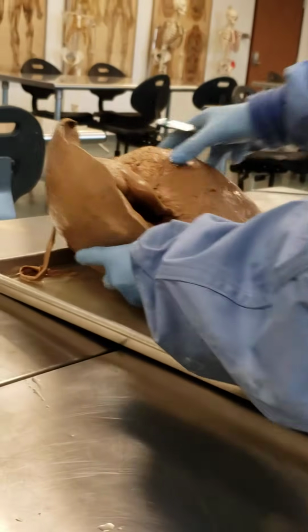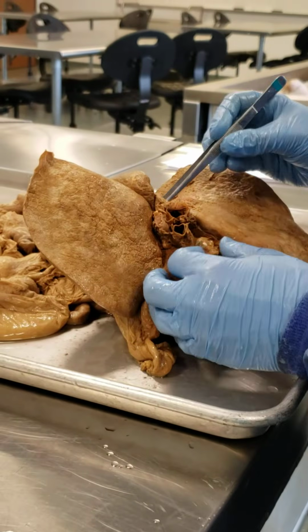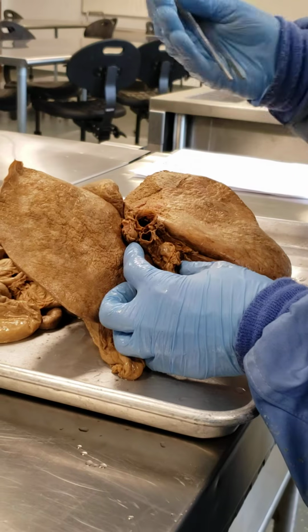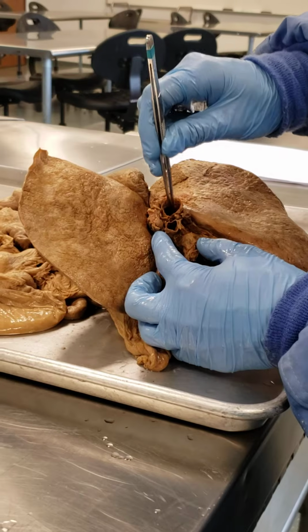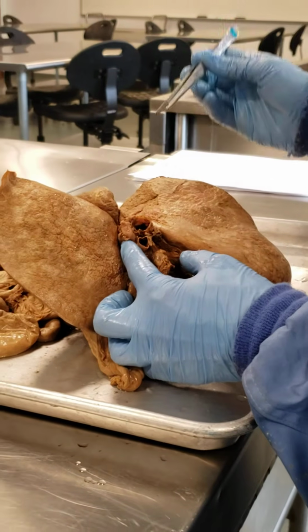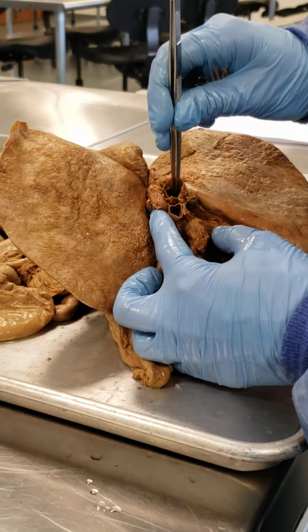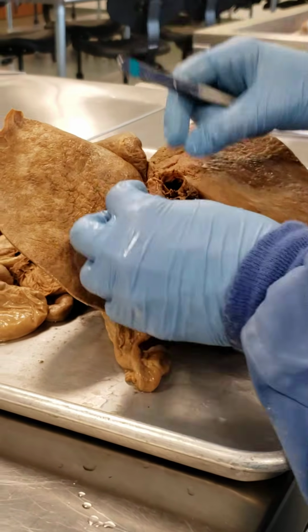Now, what I'd like to point out in another specimen, another liver, is that Porta Hepatis that we looked at earlier. So here are these major ducts and vessels associated with the liver. Here is where we would have the entry of the hepatic portal vein. That carries, remember, the blood from all the other visceral organs that drain into the liver, because the liver has first pass metabolism, first shot at everything.